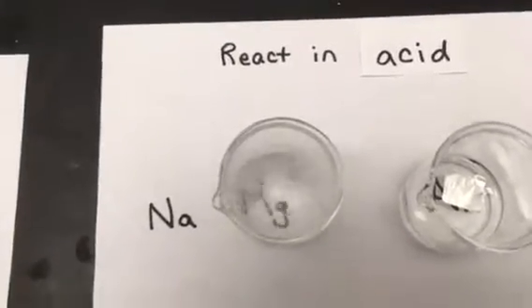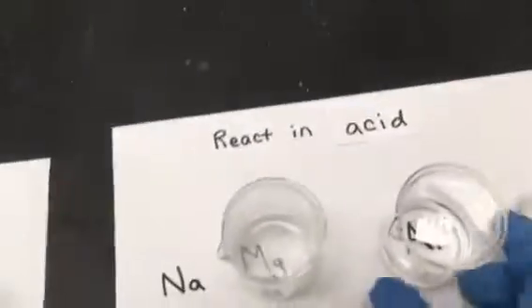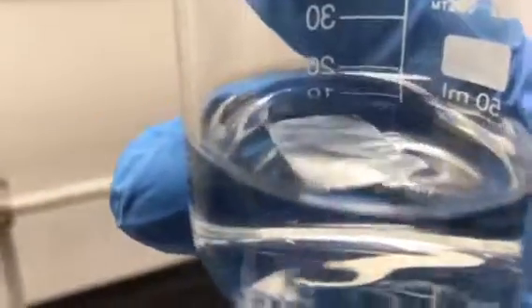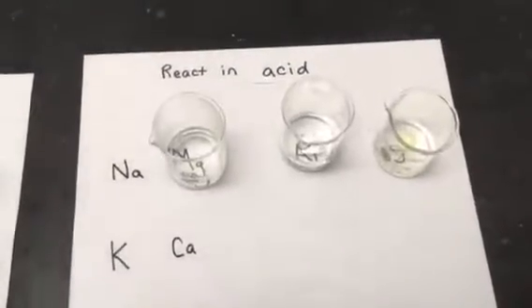Okay, so you can see the magnesium is definitely reactive. Of the three, you can predict which one's most reactive. For the aluminum, it doesn't really seem to be doing much, but if you look at it really, really closely, you can see that there are some really tiny bubbles that are coming off. So this is reacting. It's just that it's a little slower than the magnesium.